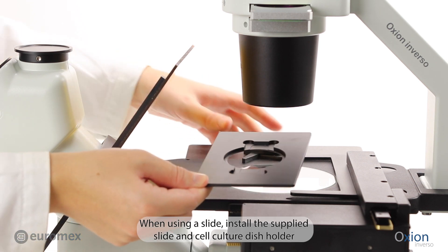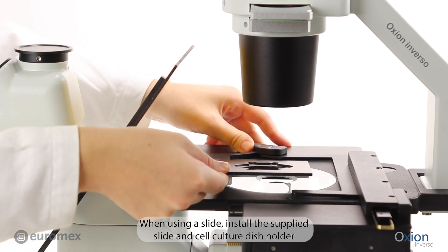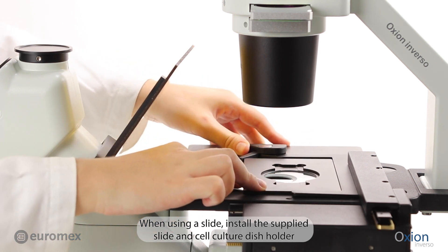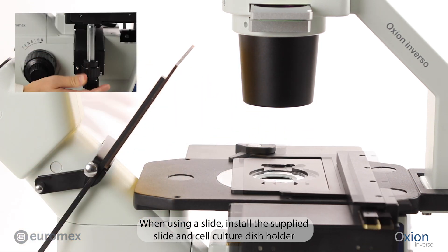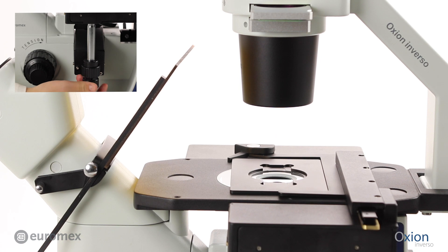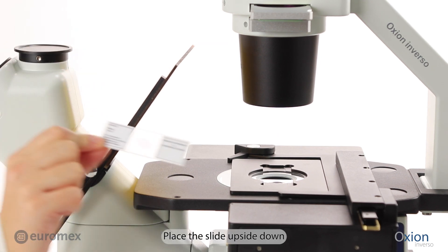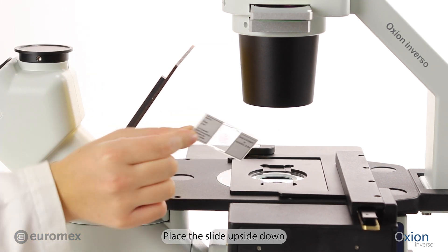When using a slide, install the supplied Slide and Cell Culture Dish Holder. Place the slide upside down.